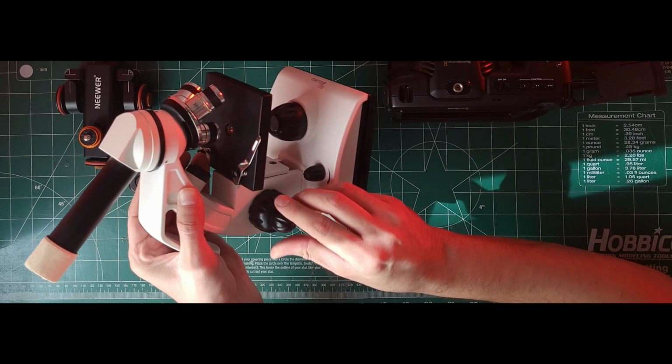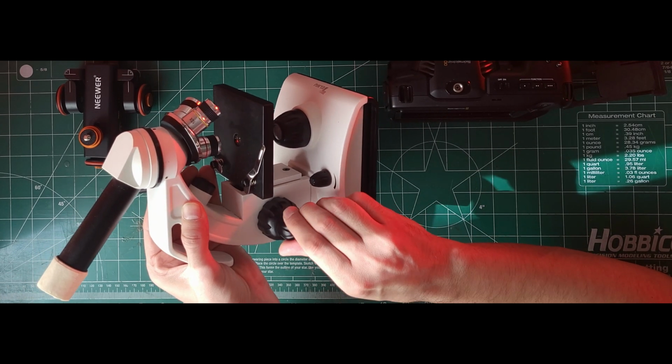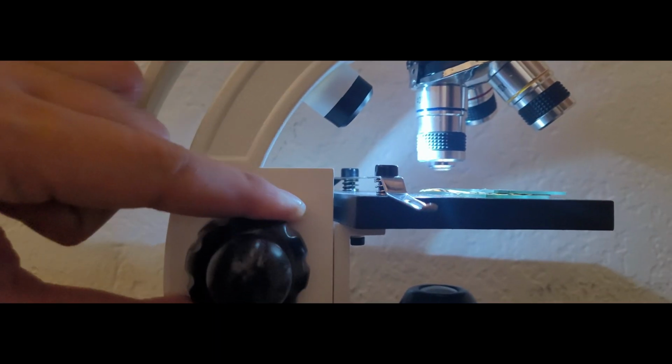Using the whole microscope can be easy because most microscopes have internal LED lights and a smooth focal distance controller, which allows you to focus easily, especially when you're using 20x to 40x magnification. The focal area is that narrow. When I focus on the blood cell core, I lose the focus of the other part of the same cell. For this reason, if you don't have a flat object, focusing will change constantly depending on the distance.